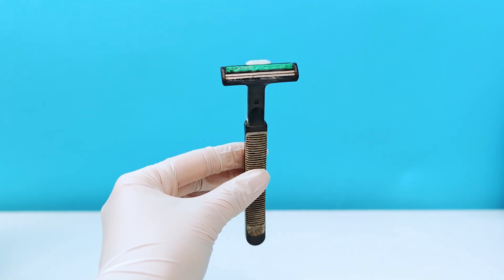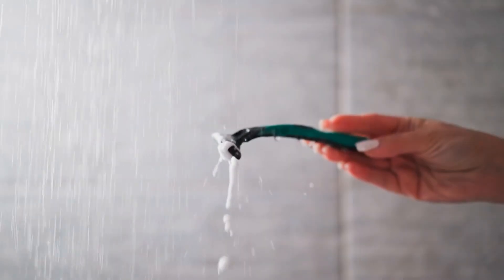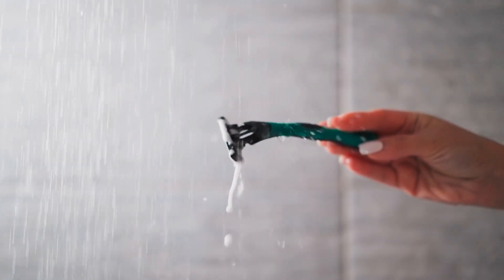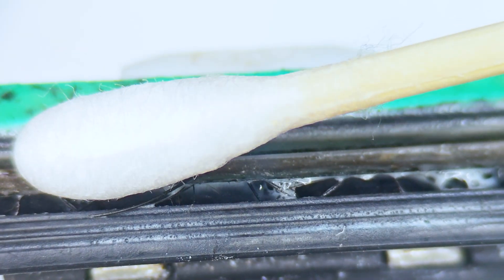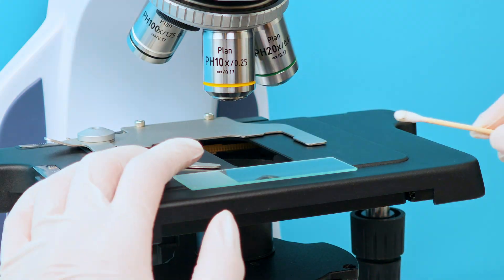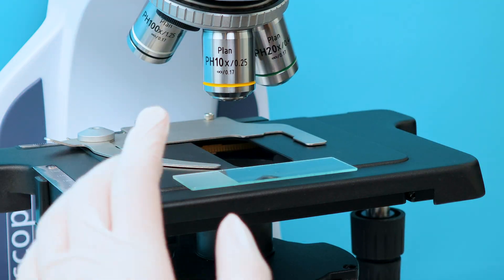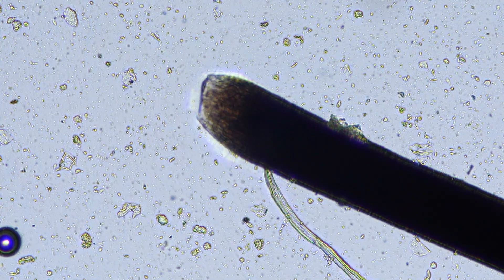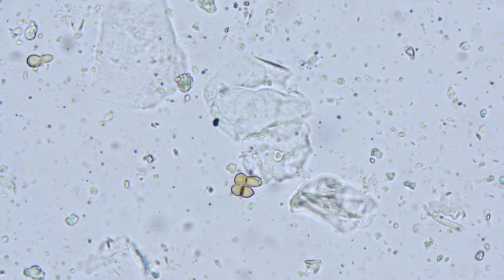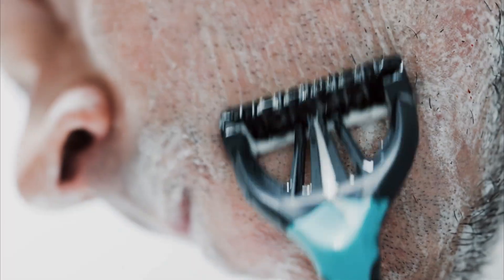Now let's look at the razor — an item that comes into direct contact with your skin, and sometimes even blood. Many think a quick rinse is enough. But under a microscope, the reality is far different. You'll see dead skin cells, shaved hair, clusters of bacteria forming a web, and even Demodex — tiny parasites that live in human hair follicles. If the blade is slightly nicked or you have an open wound, bacteria from the razor can easily invade, causing infections or abscesses.